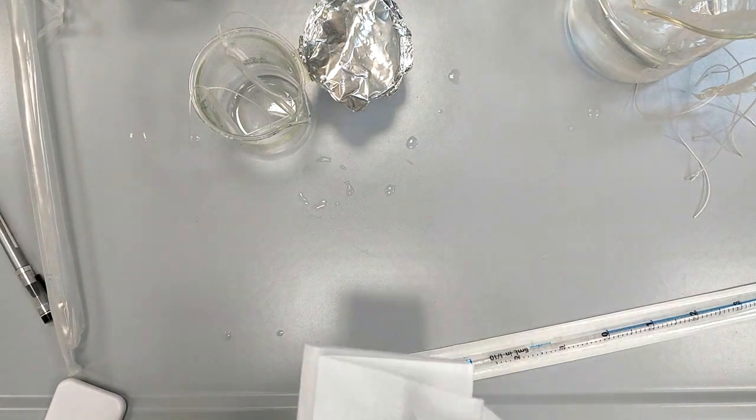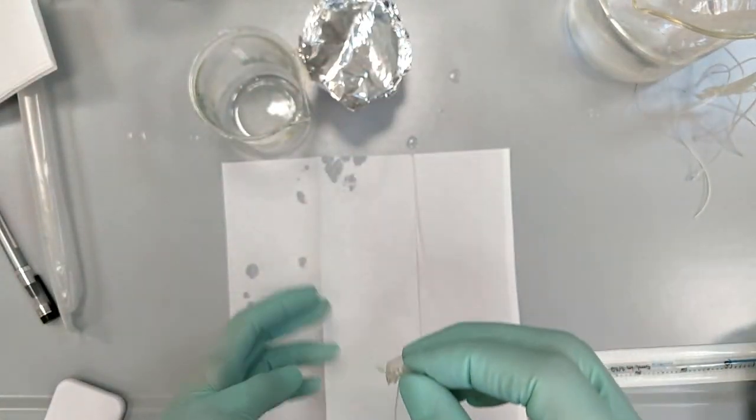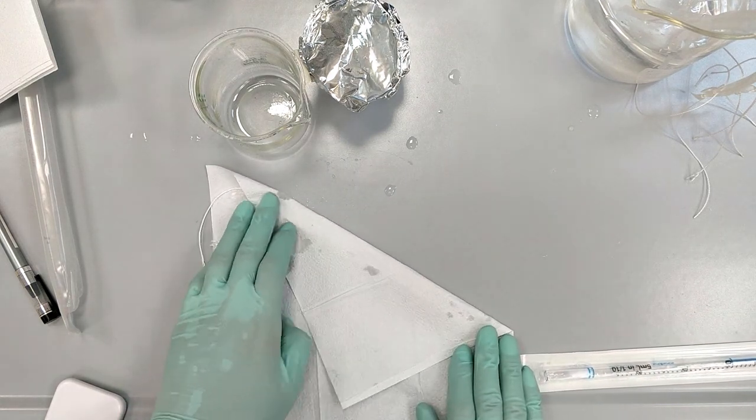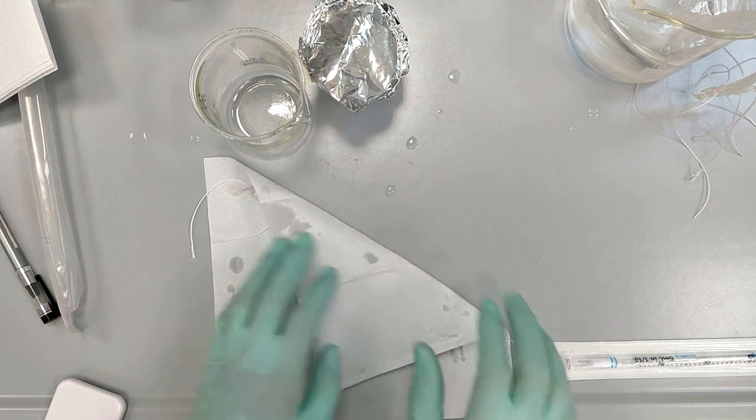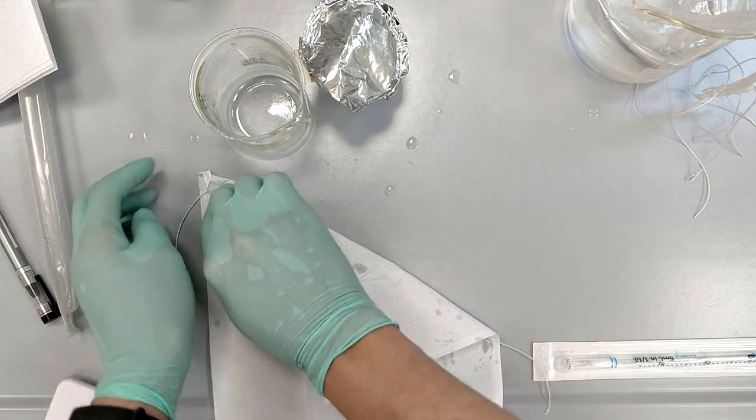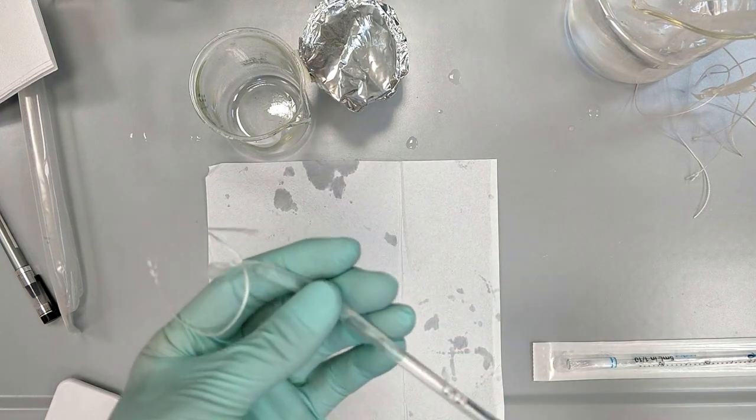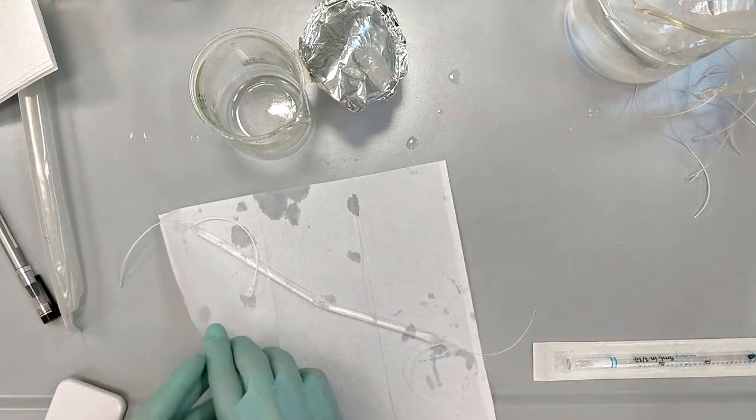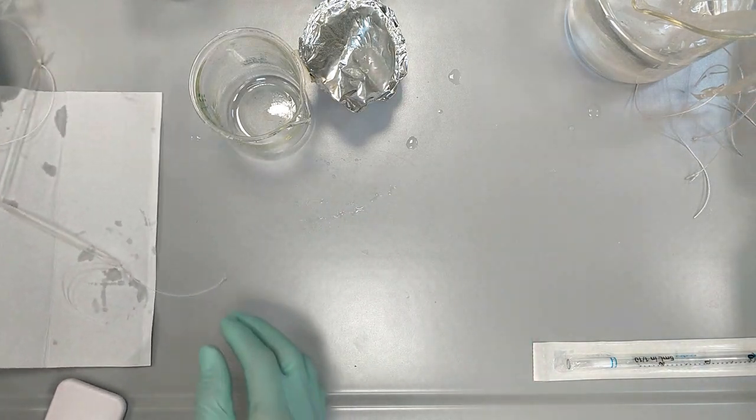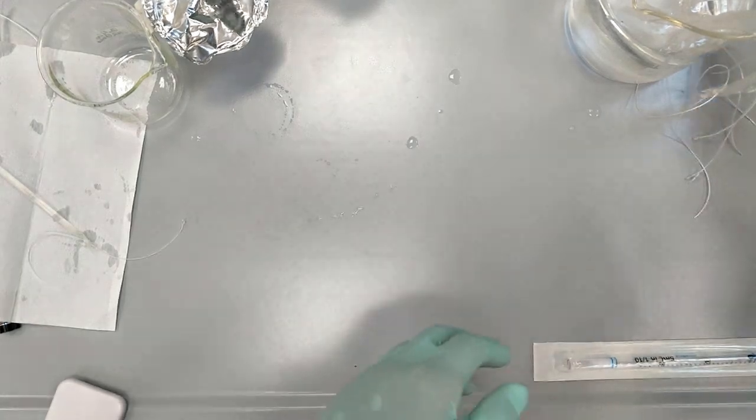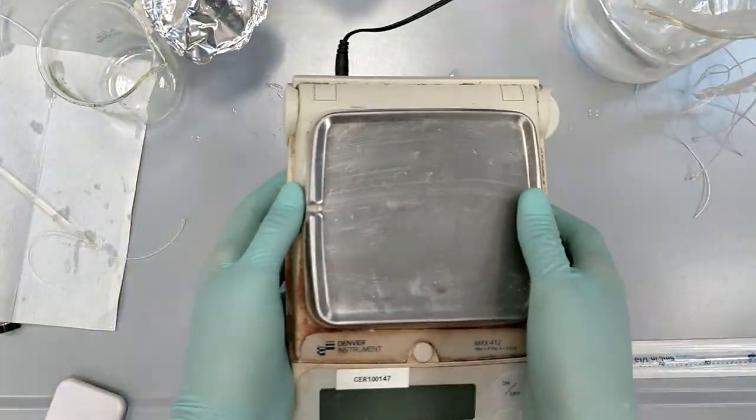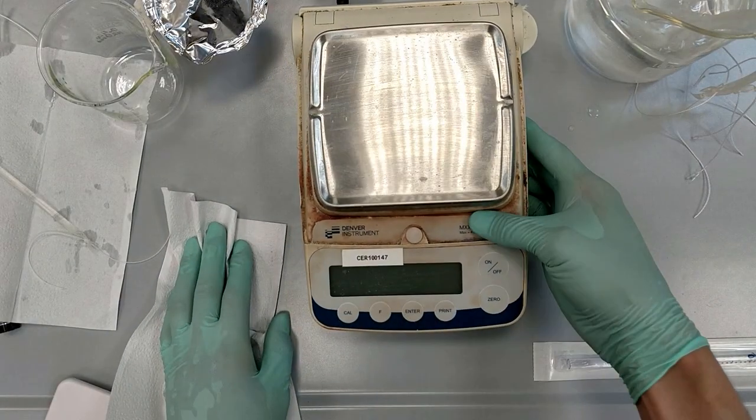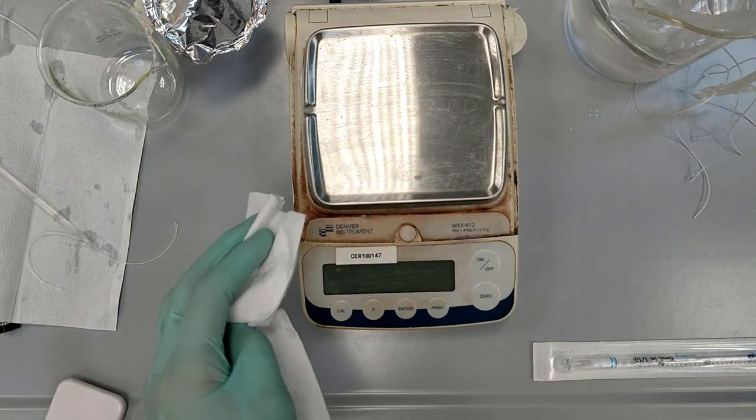Don't forget to label your beakers. Be very gentle not to tear the dialysis tube. Remember to clean your bench when it's dirty.